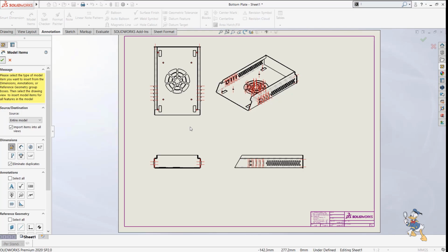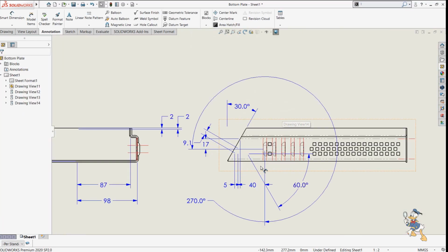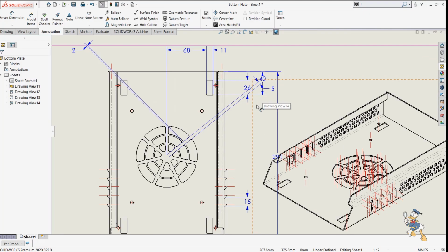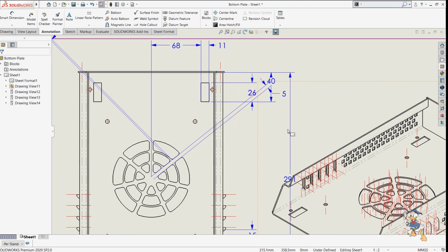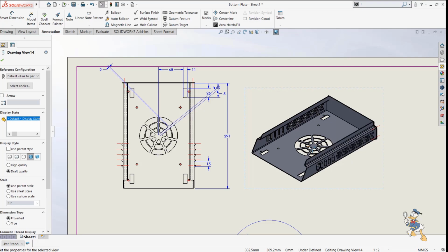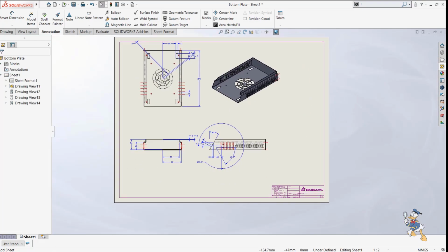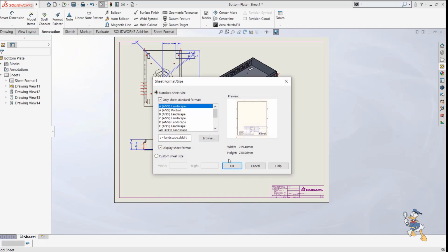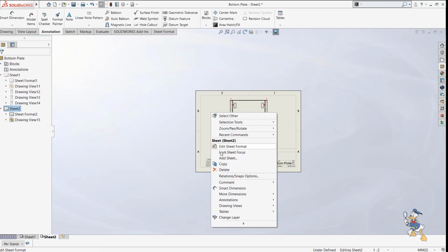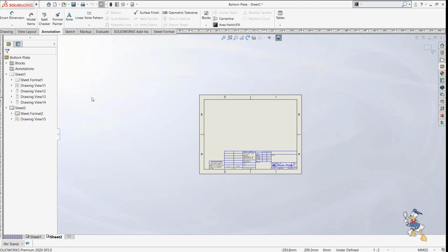I just need to select the entire model, and it will generate dimensions for me automatically. I don't need to invest my time in generating dimensions in the drawing. As you can see, it generates dimensions where I need them, and it automatically gives some center lines. Whatever the dimensions are, they come in automatically. Suppose we don't need some center lines in this model, we can delete them, and we can make the 3D feature visible like this as well. And suppose we want to generate a flat pattern view. If we want to add a flat pattern view, we just need to select a view from the model. And suppose the sheet format is not suitable for us, we can change the sheet format as well.